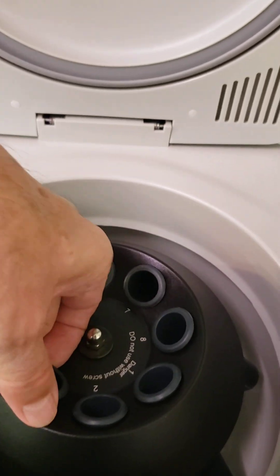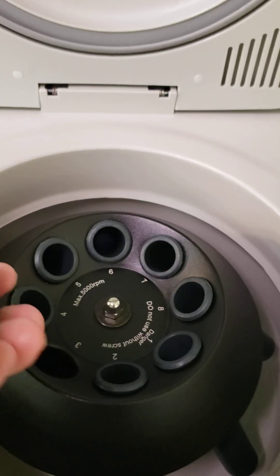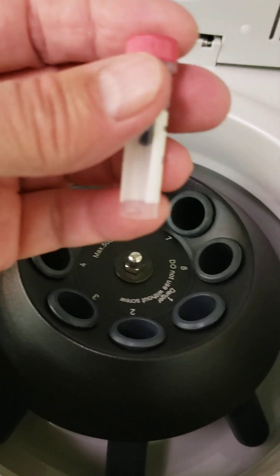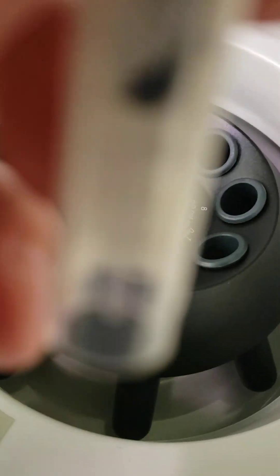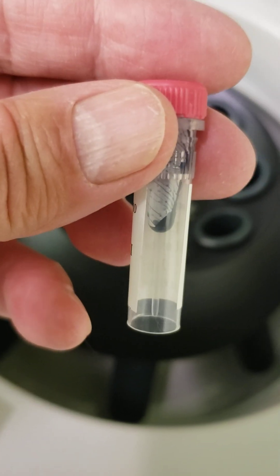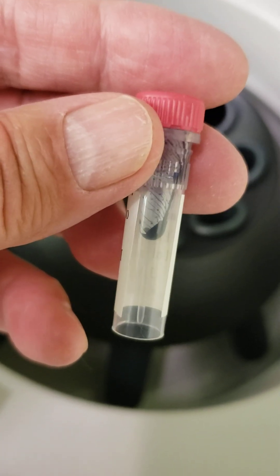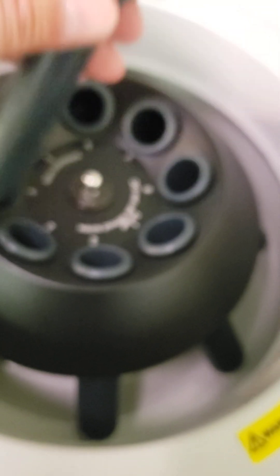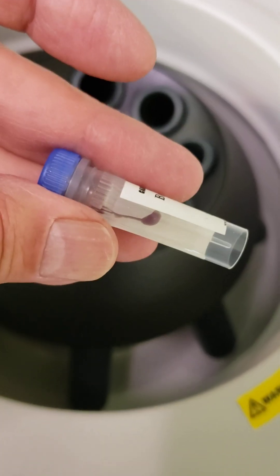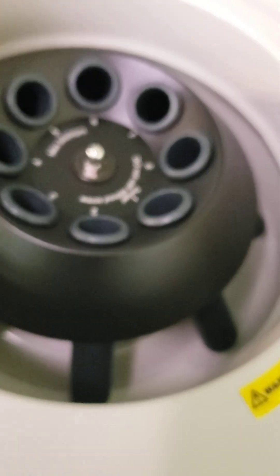And so, pull out — that's one of them. Let's see if it really made a big difference. What I'm noticing is that it does slam the dye to the bottom, but it kind of leaves this extra trail. So ultimately, it might take a couple of centrifuge spins to get this right. But, my word, what a change. This will be much easier to pipette than what I've done in the past.